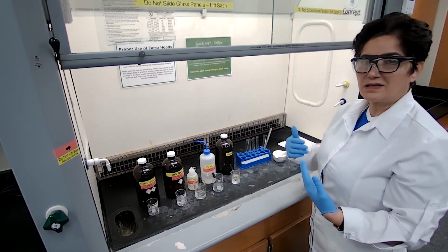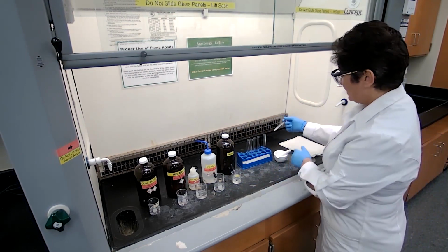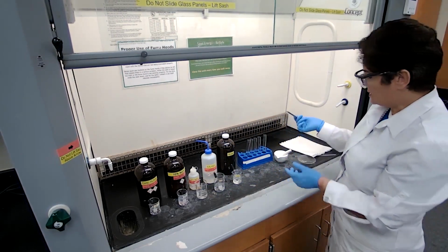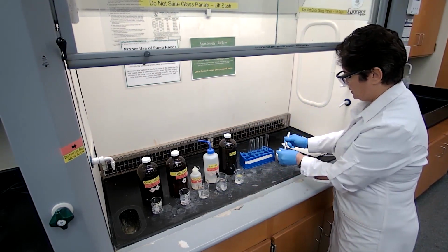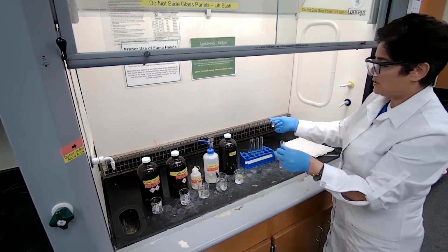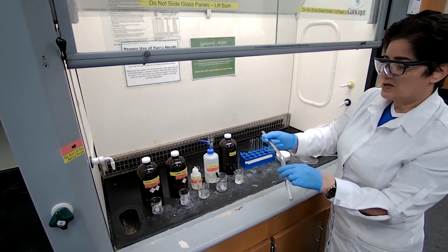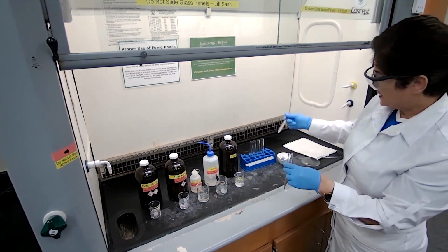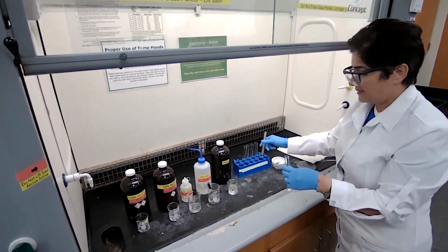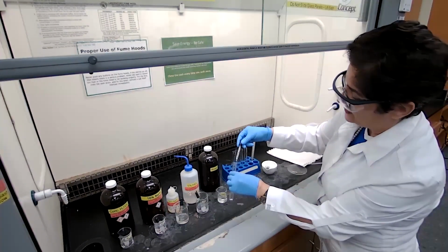So this is based on the procedure. The procedure tells you clearly, if it doesn't dissolve, move on. If it dissolves, just stop or move to the next, if you have to come up with a conclusion. So as I said, last lab, I'm just using a tip of a spatula of the sample, and I am adding 3 full droppers of the solvent.